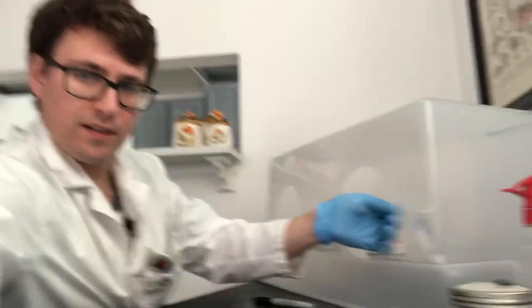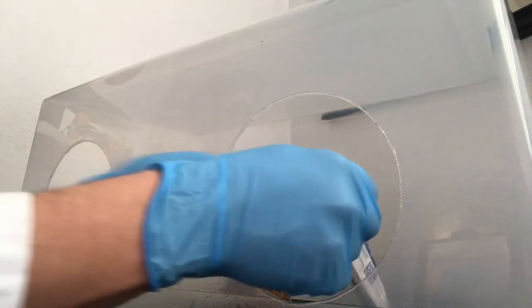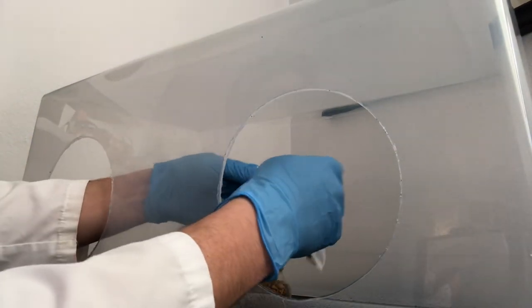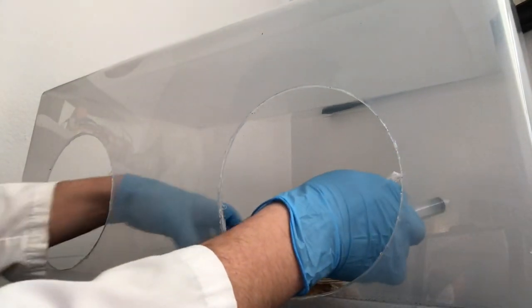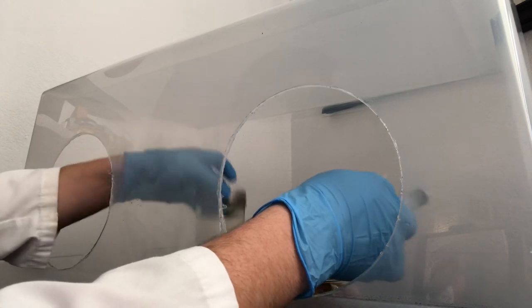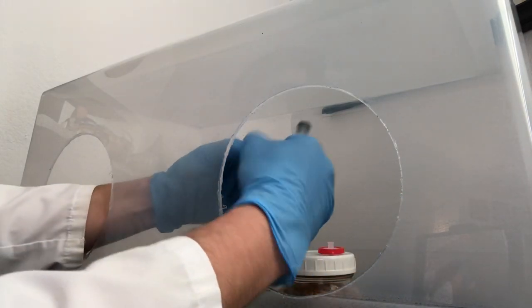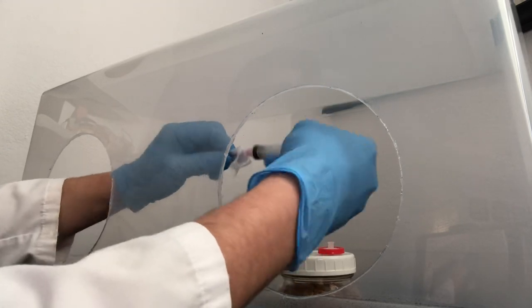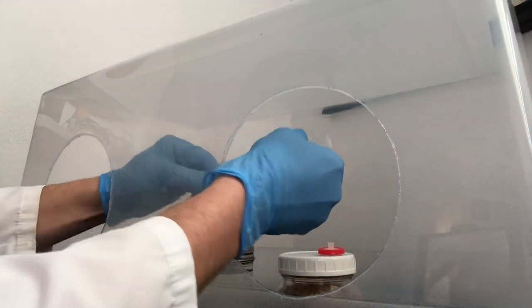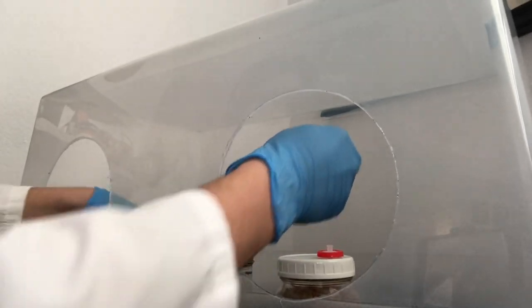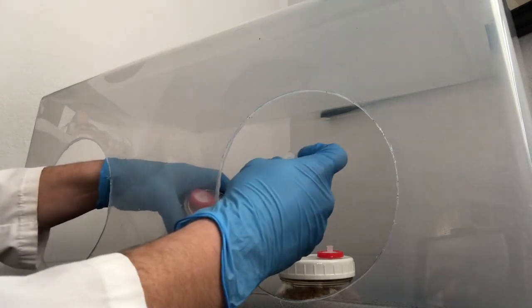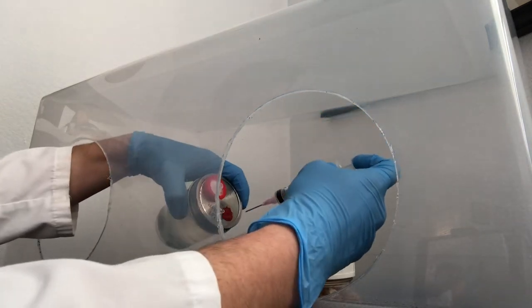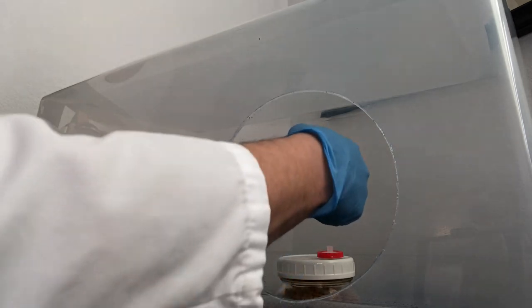I can move this so you guys could see what I'm doing here. I'm just opening my syringe up like normal and you can see my liquid culture right here.